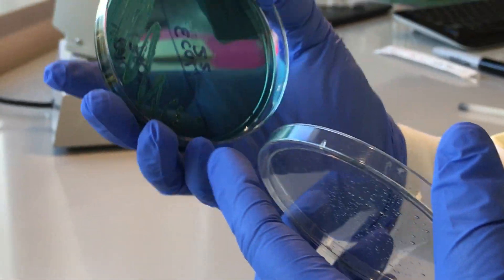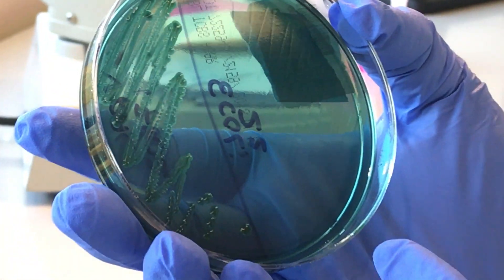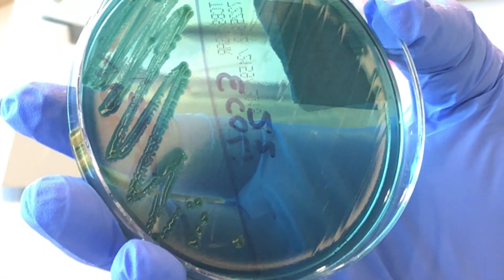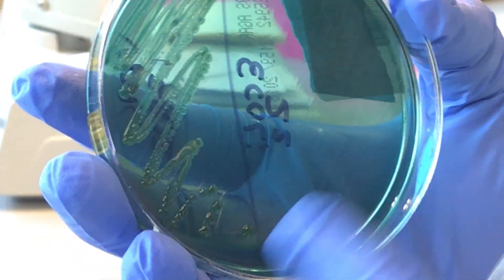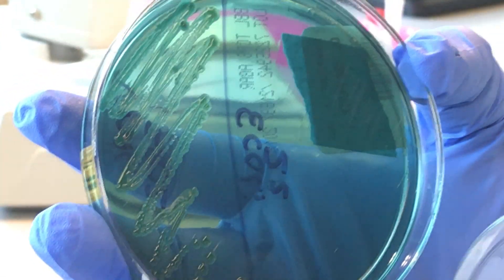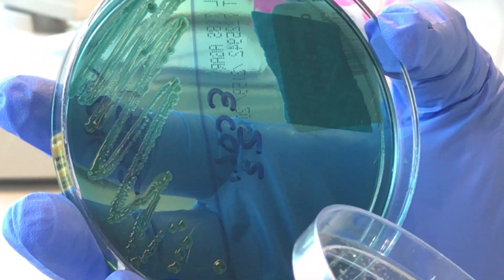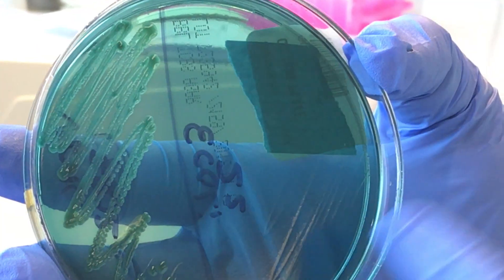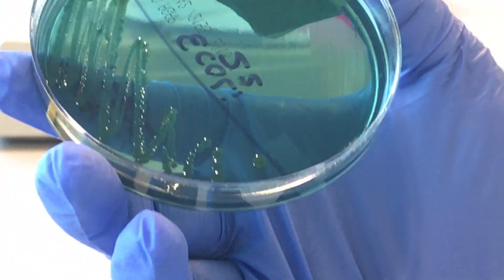This last one is Vibrio. This is TCBS agar, which is selective for Vibrio. You can just see they're dark green, almost blue colonies. And then E. coli didn't grow because it's not going to grow.